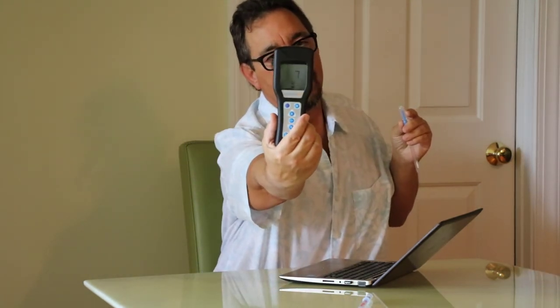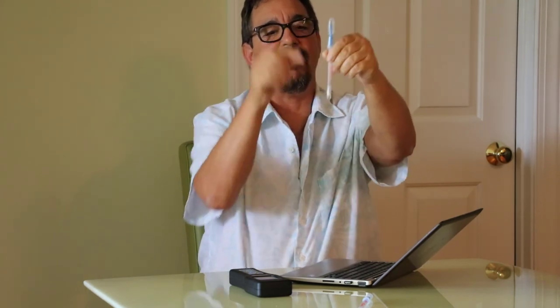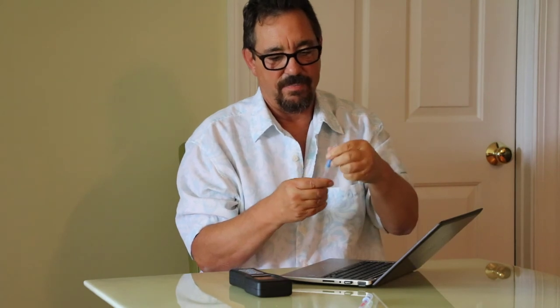Remember, we want to go crisscross, turning the swab as you do it. Put it back in, break the top, squeeze it to get the liquid down, and shake it for five seconds: one, two, three, four, five. Put it inside the machine, close it, hit start. It's counting down. We're going to wait for it to finish. Hopefully under a 10 — like I said, it went down to a 9 while I was sitting here. There we go, it's done. I got a 10 — it's a passing score. This number will probably go down a little like the other one did.